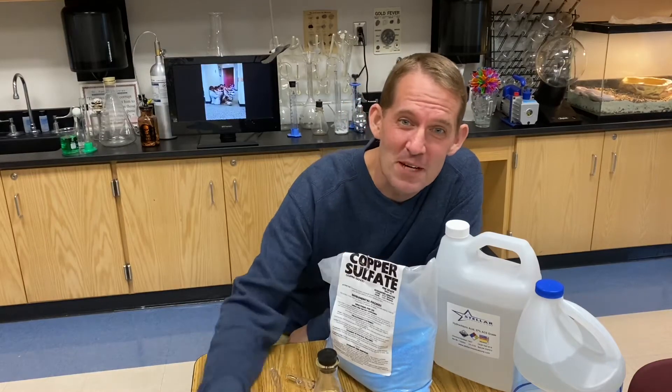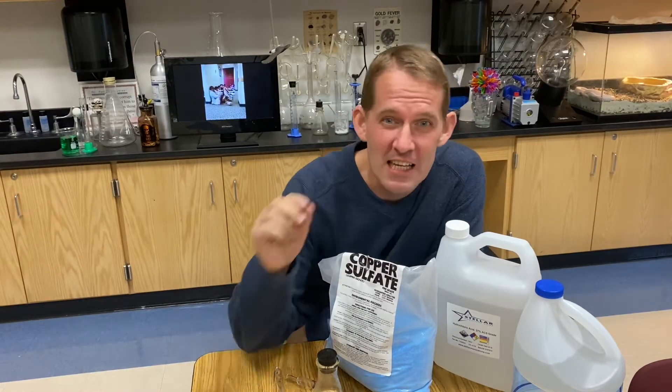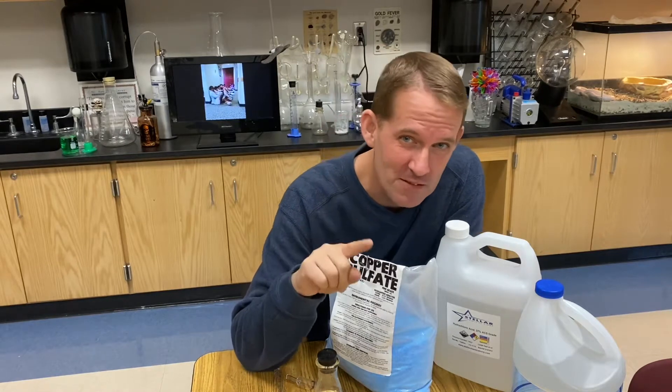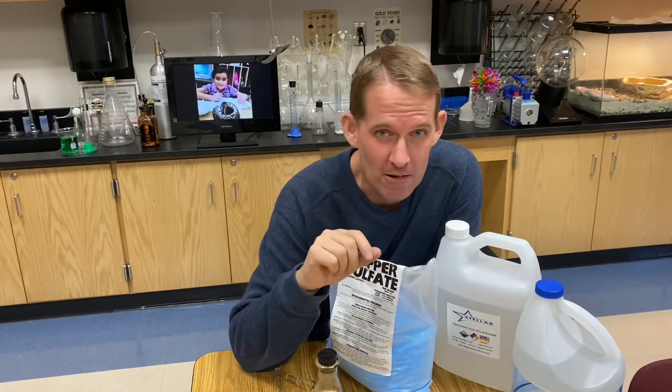Welcome back to Ramsey Land. Today I want to share with you Le Chatelier's equilibrium principle with a little bit of copper sulfate, some ammonia, and some hydrochloric acid.